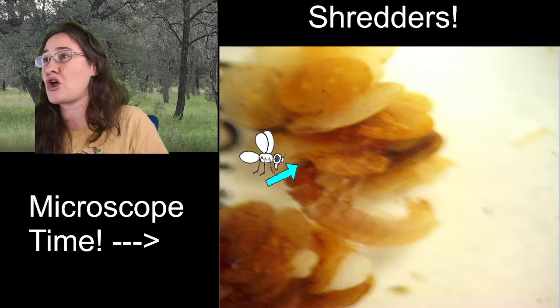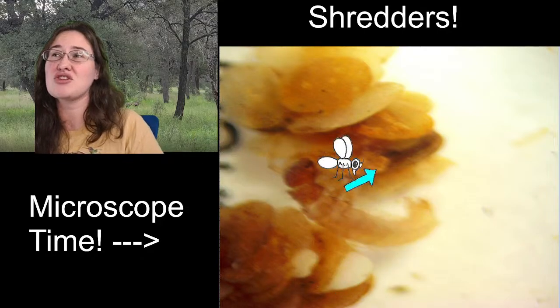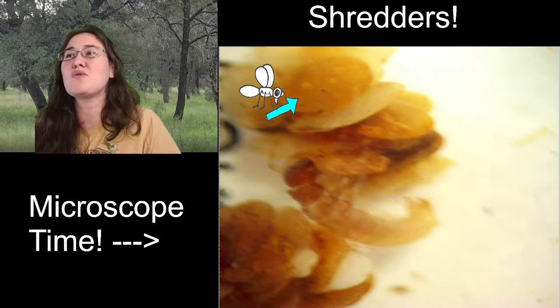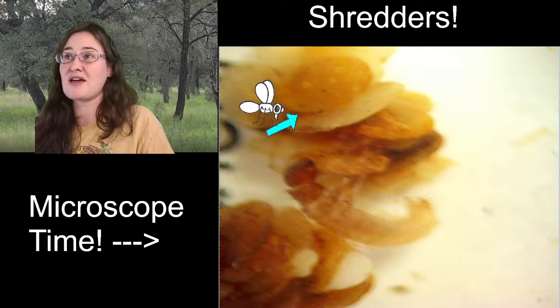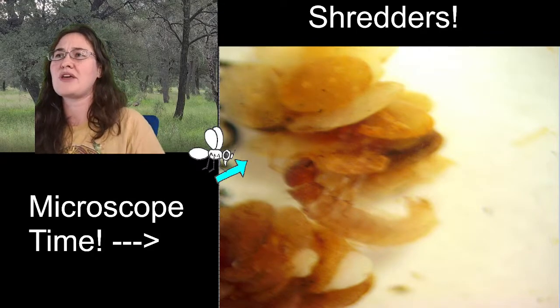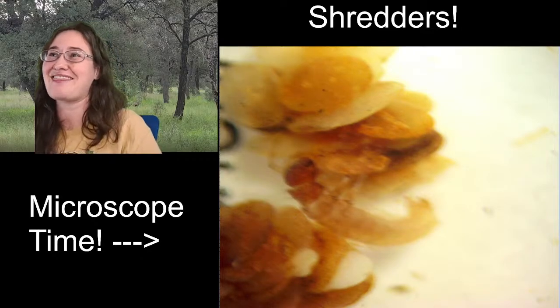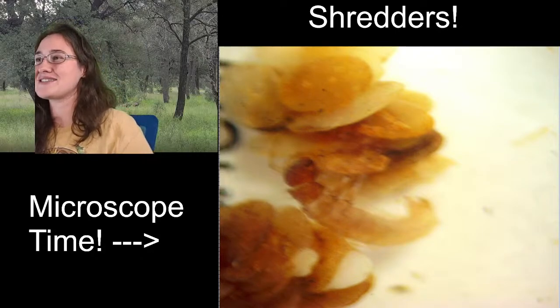Generally, they are not going to be leaving the case, but when you collect them and put them into ethanol, you want the specimen separate from its case, just so that you can ID it by the characters on its legs and its head. But you also want to keep the case, because sometimes the case helps you identify them to family by what they look like or the materials they're made out of. Each of the families has their own unique way of making their cases. And those are caddisflies.